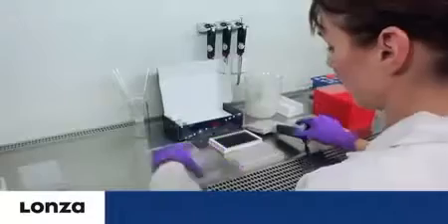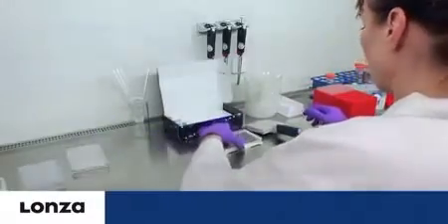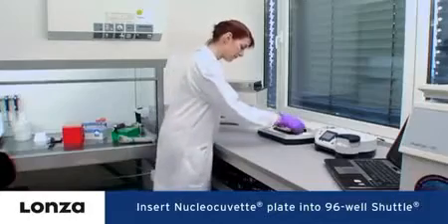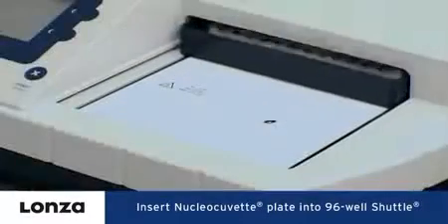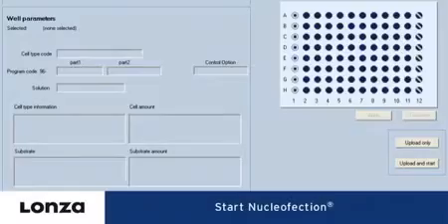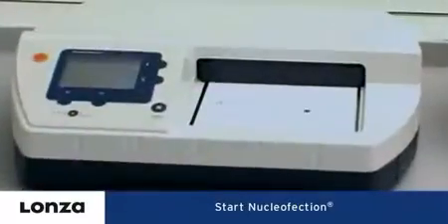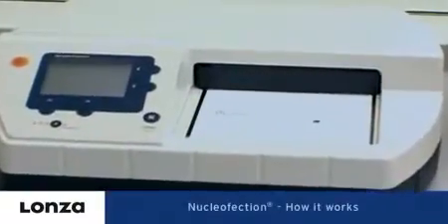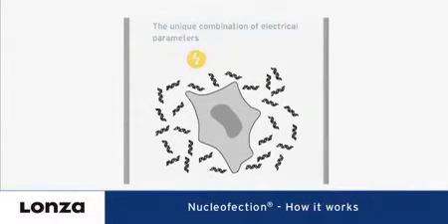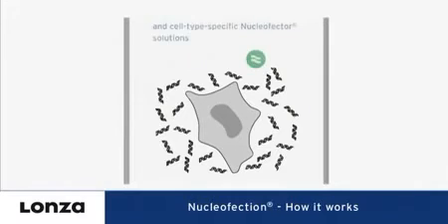Cover the plate with the lid. Remove potentially residing air bubbles by gently tapping the plate and insert it into the retainer of the 96-well shuttle. Nucleofection is started by clicking Upload and Start in the software. Each well is now individually processed. Processing the whole plate will take between three to five minutes, depending on the applied 96-well programs.